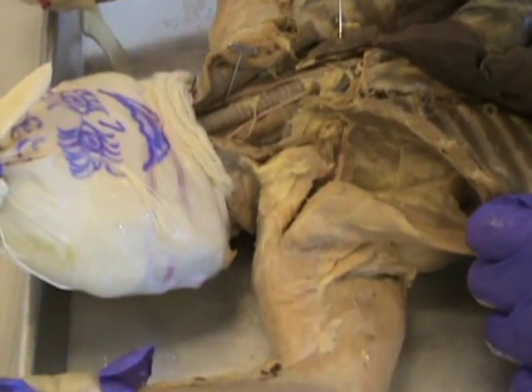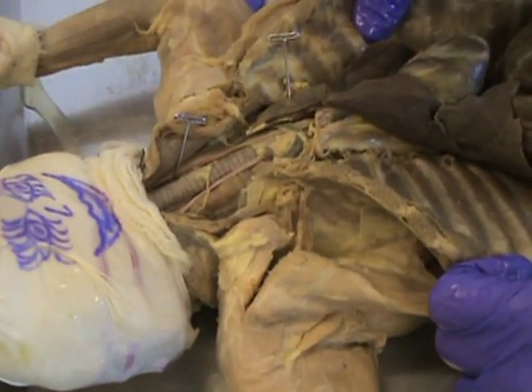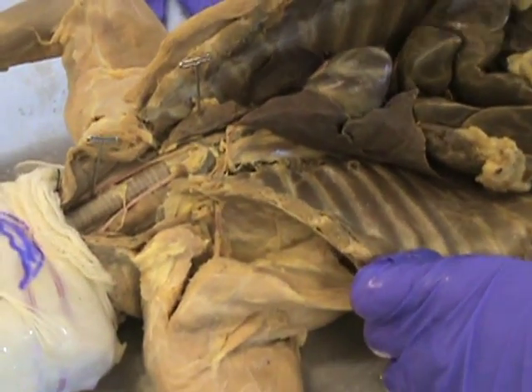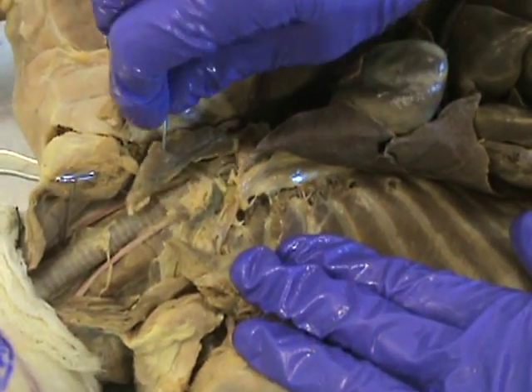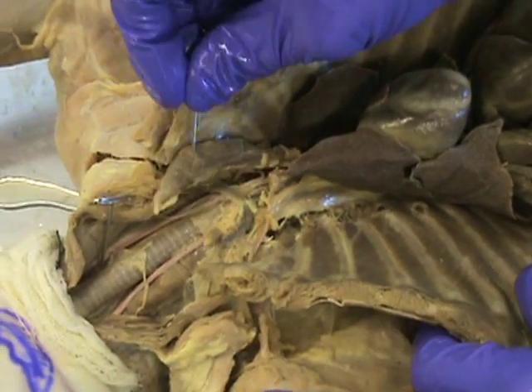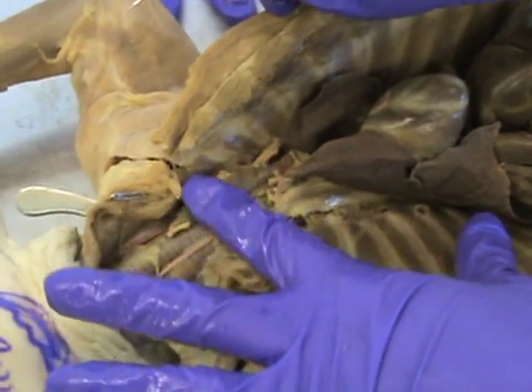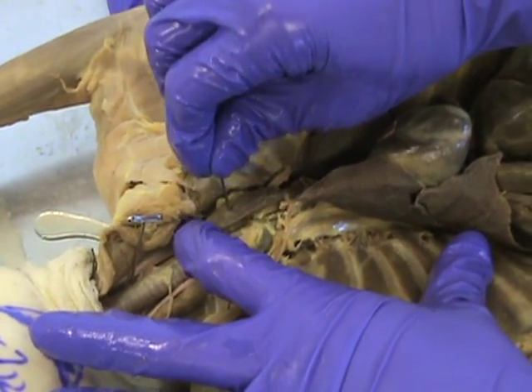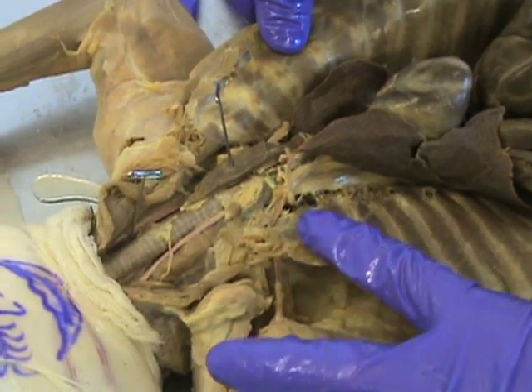We're going to take a tour of the lymphatic system. It shouldn't take very long, so let's start with the thymus gland. It's that chunky piece hanging right there — Jersey was nice enough to put a stick in it. The thymus gland's function is it programs T lymphocytes for distribution to the body.